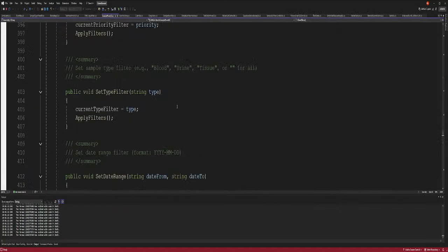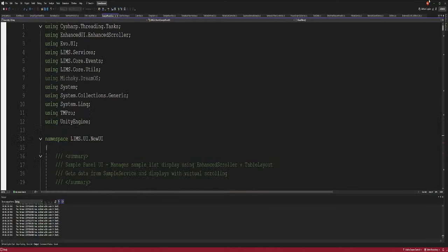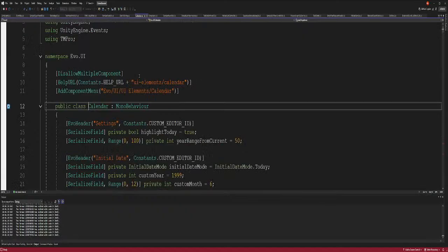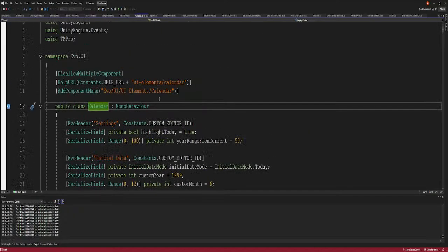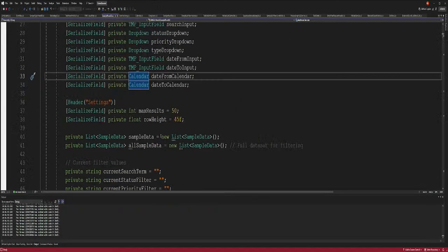All right, so the calendar dates. Let's go to the top. So we decided to make a reference to this class calendar. I usually don't like doing that, but it was the easiest way. And this is a plugin from Michsky. I'll give you the links later. All right, so we made it.